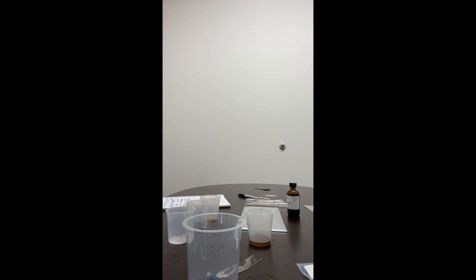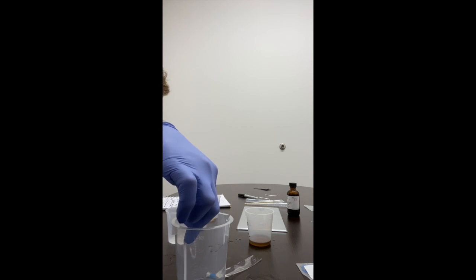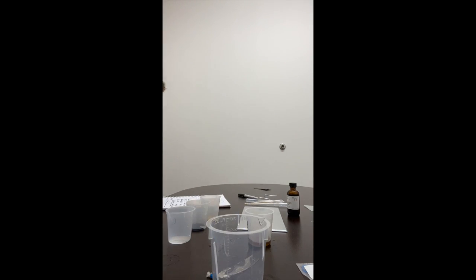Test the beaker water for the presence of glucose by adding a strip. By dipping 1 glucose test strip into the beaker, wait 1 minute before reading the results to test strip, and record the results into table 4. So we will wait a minute.